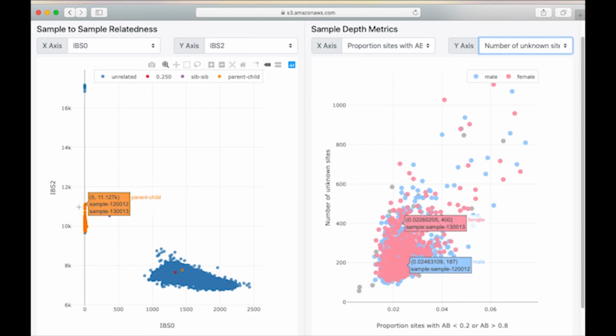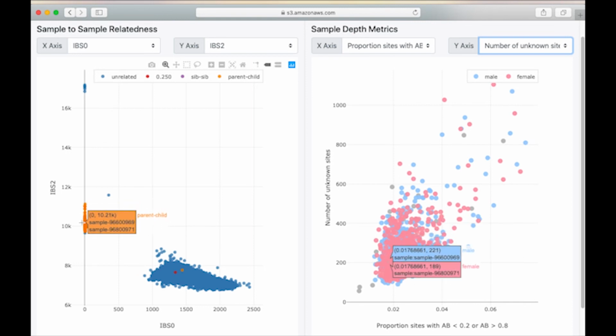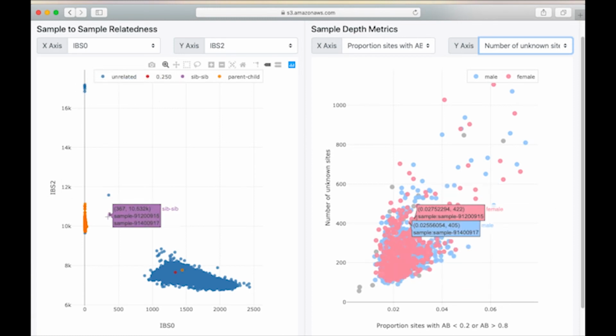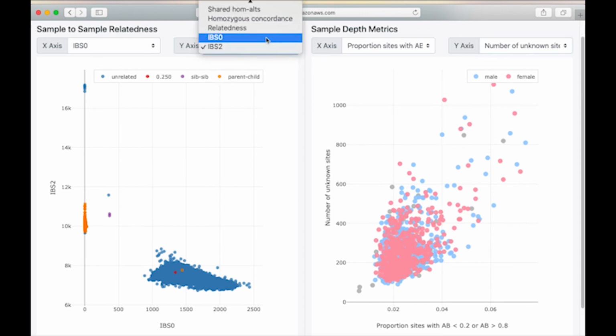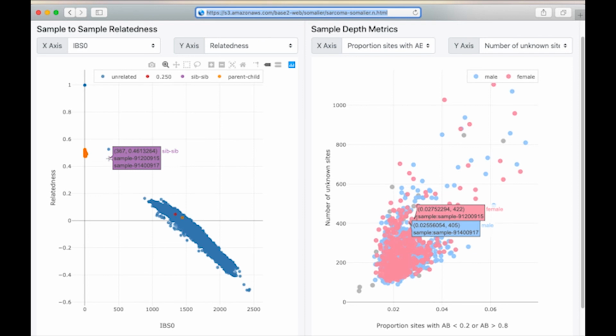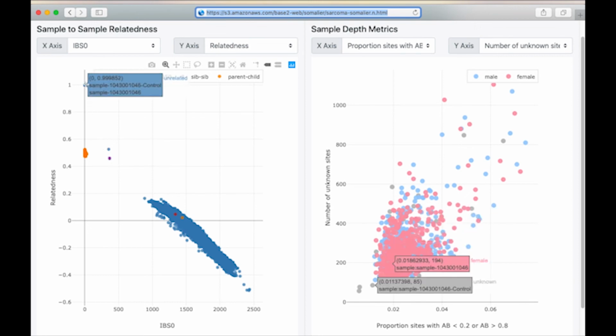And so we see that the expected parent-child pairs all cluster close to 0. IBS 2 on the Y-axis is the count of sites where a pair of samples had the same genotype. The cluster above 16K are duplicate samples and identical twins. This is a cluster of siblings. By switching the y-axis to relatedness, we can see that the siblings have a relatedness of around 0.5 and an IBS 0 above 0, as we would expect. We can also see that the duplicate samples have a relatedness value of 1, again, as expected.